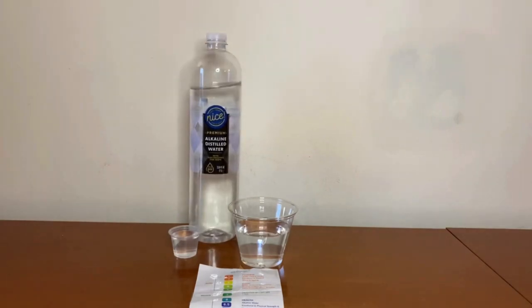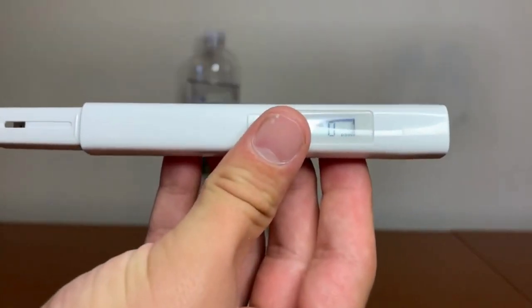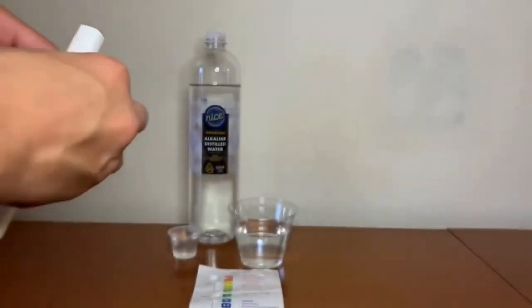First let's test the TDS level. Turn on the TDS tester. Make sure it says zero and put it in.